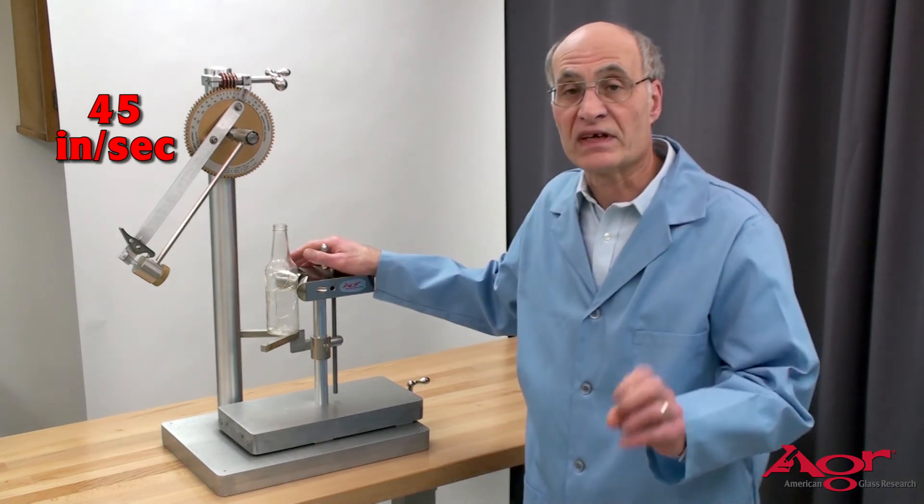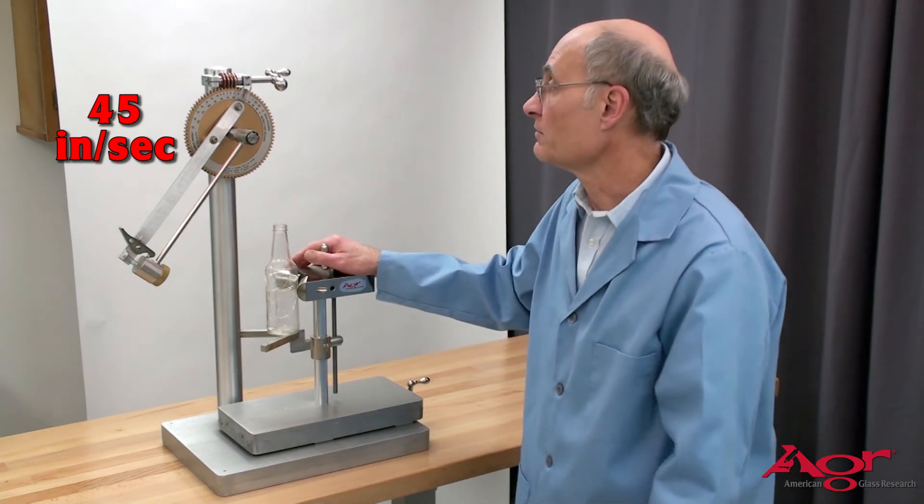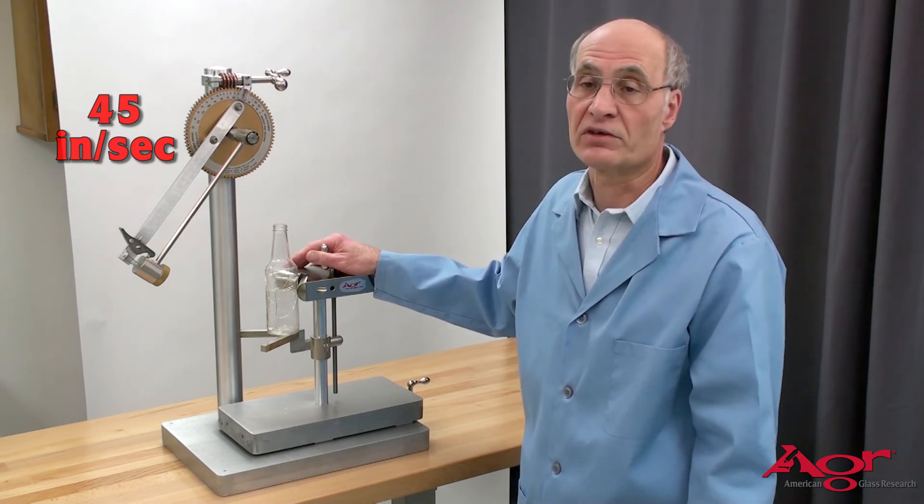In that case the bottle survived two impacts at 45 inches per second and broke on the third.